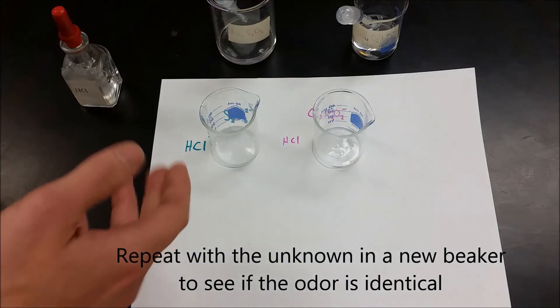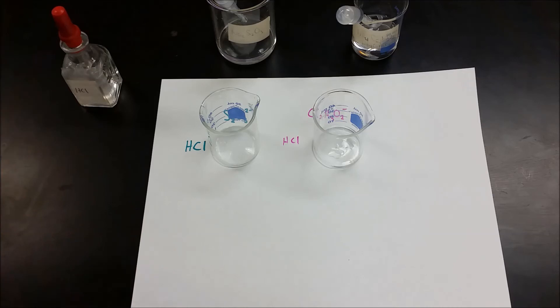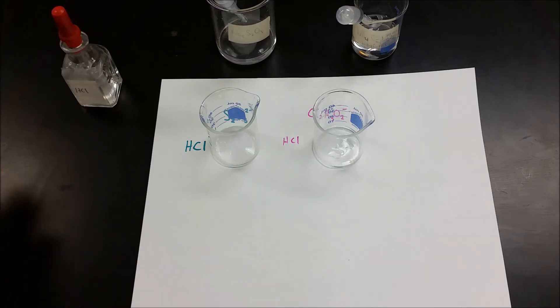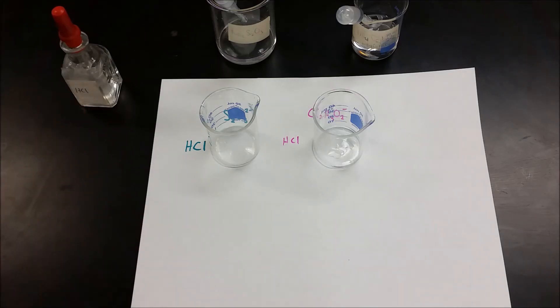If you're having trouble, you can heat these. You can also try pouring them into the sink. In the sink they'll really spread out and you'll get a much bigger odor.